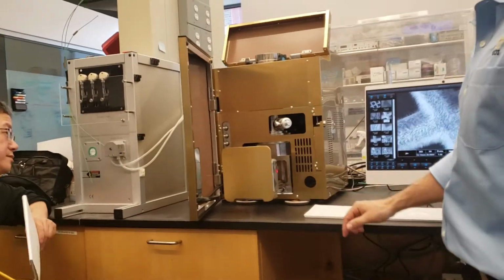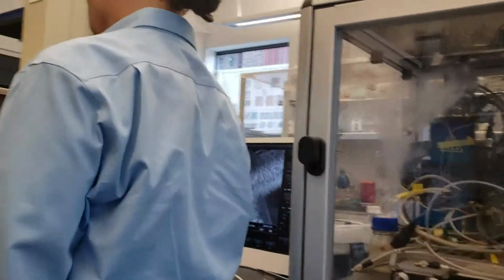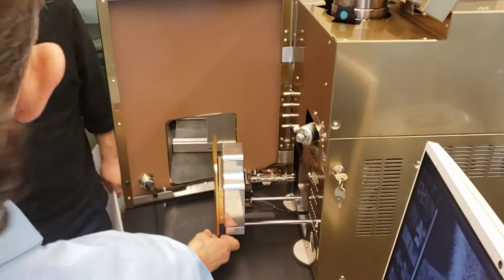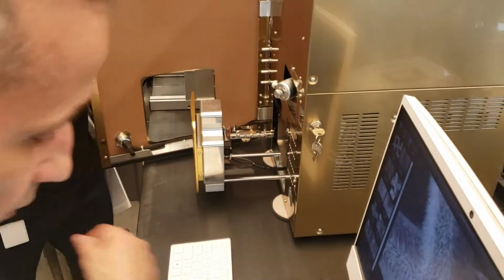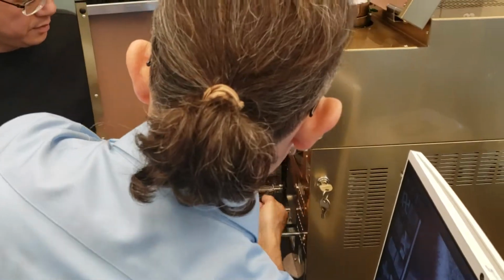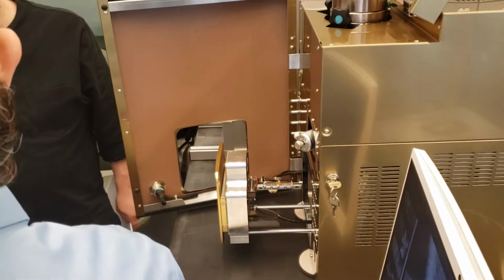All right, so the microscope vented, just really quick, for me to show you guys. So if you come around here, or wherever you can see the best, yeah, just come around. So this is your sample chamber, right? And it just slides open. And this sample's in there right now. For instance, I've got one sample in here, which is one of your samples.